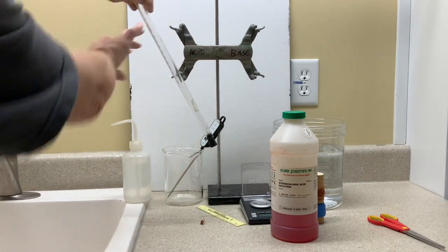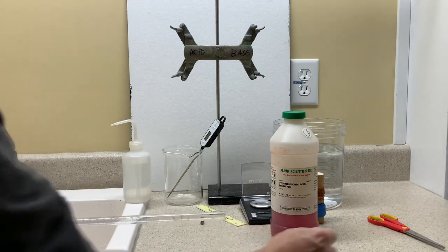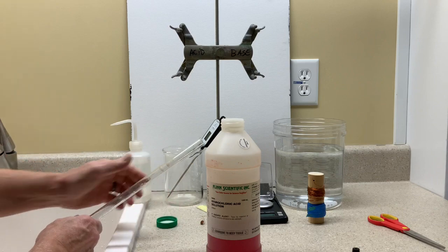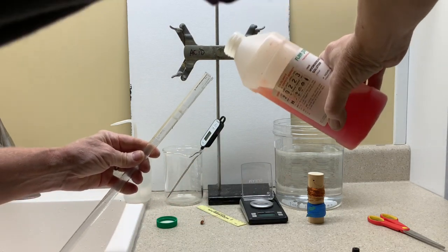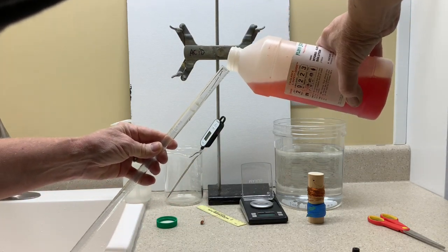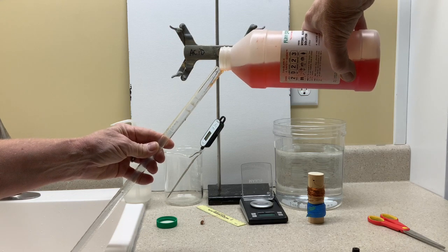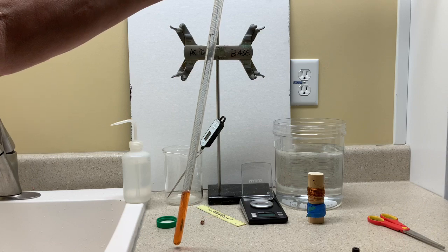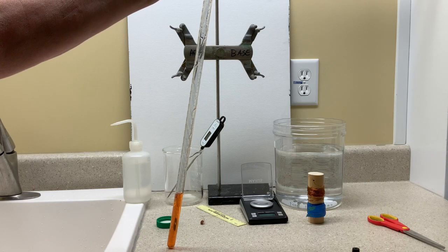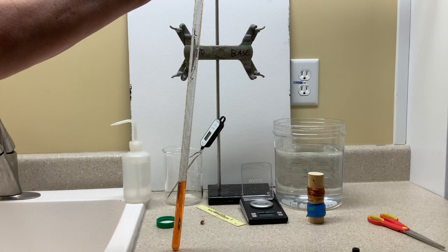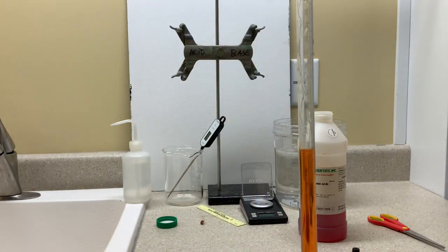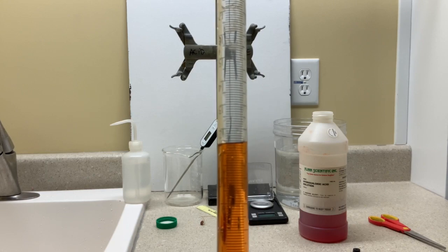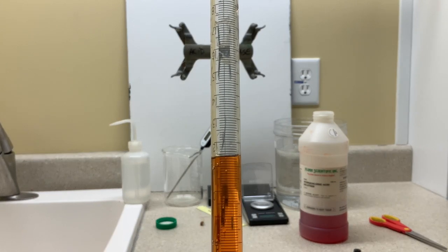Next we'll add the three molar acid that you calculated in the pre-lab. The bottle may say six; I think it's been a bottle that's been repurposed. A little bit of red food coloring has been added so that we can see the acid as the reaction takes place, so it'll be a little more obvious since it's a different color than the water. You calculated a particular amount in the pre-lab. You can see I've used a little bit extra; doesn't really matter since the acid is excess during this reaction anyway.